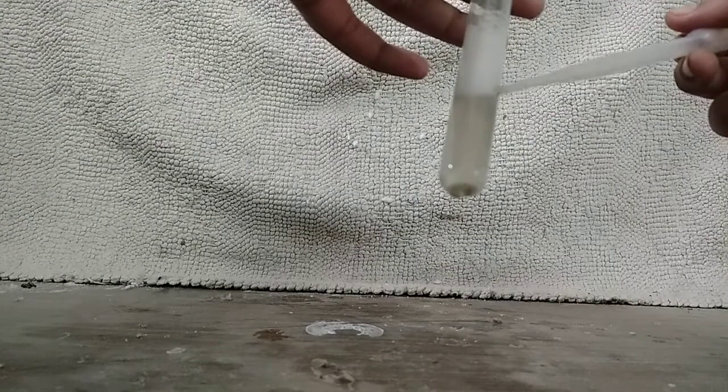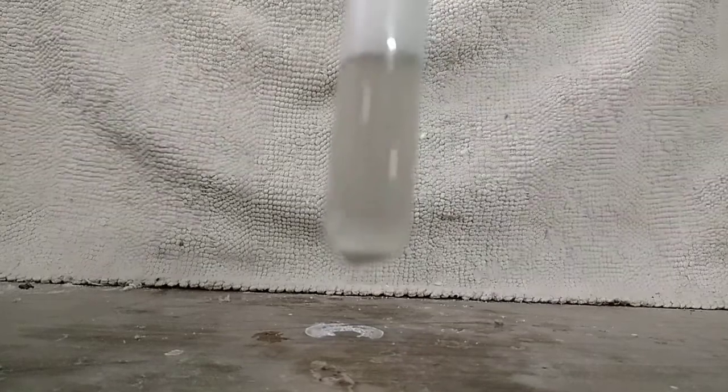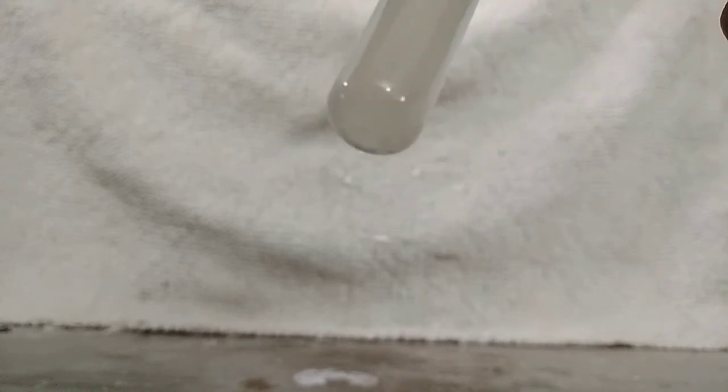The solution is bubbling a bit and a white precipitate is forming — this is much more clear in person. If you look at the bottom, you can see a white solid that has formed. I can just mix it to get that solid back in suspension, and after some time it will fall out again.